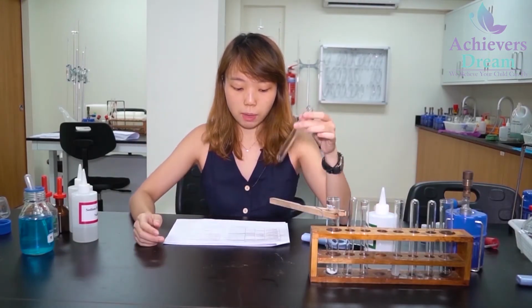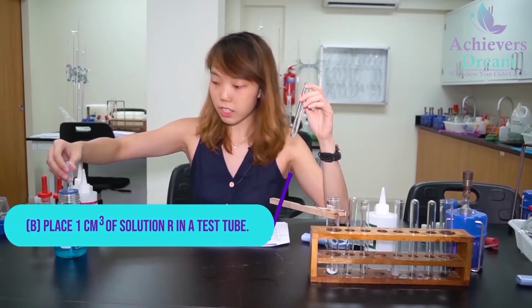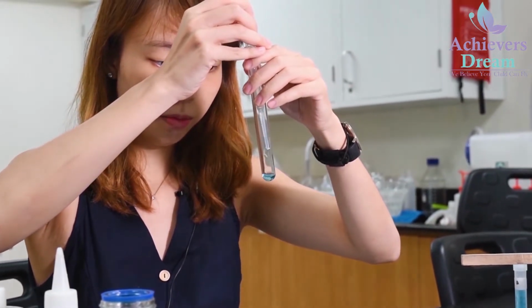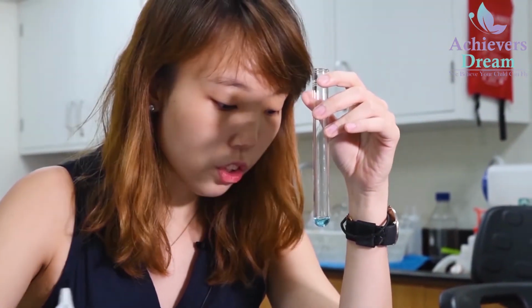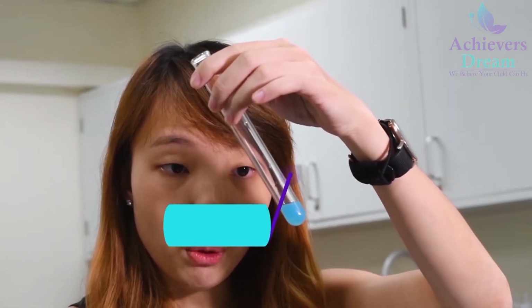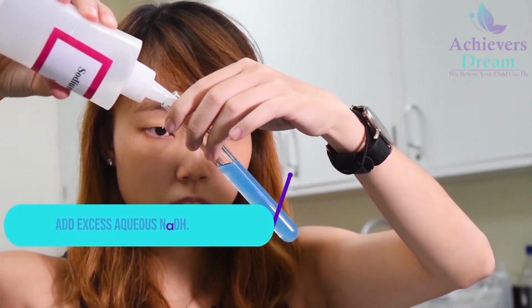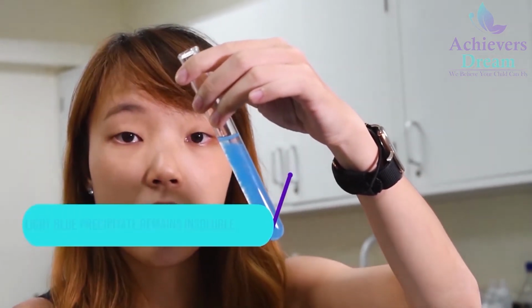For the next step, I'm going to place 1 cm cube of solution R in a test tube. Then I'm going to add aqueous NaOH, followed by excess NaOH. So this is when I add in a few drops. You'll notice that there is a light blue precipitate that formed. Now I'm going to add in excess. Your light blue precipitate remains insoluble even in excess.